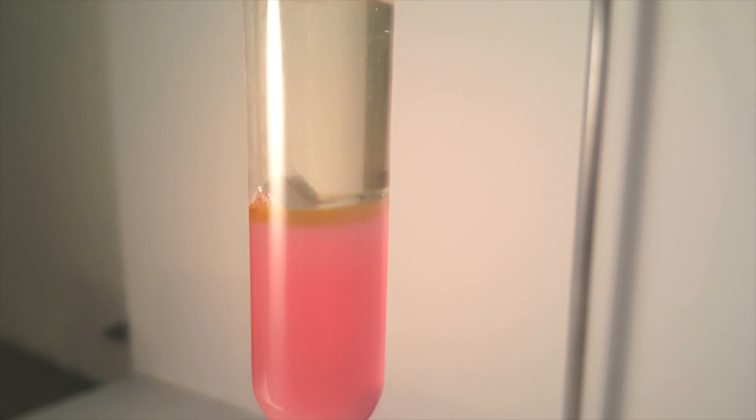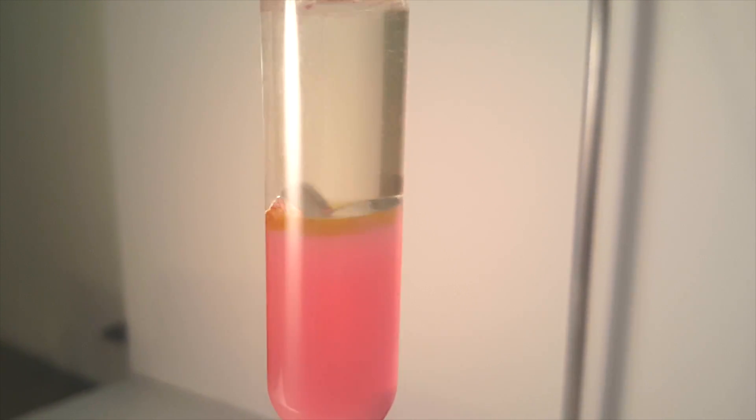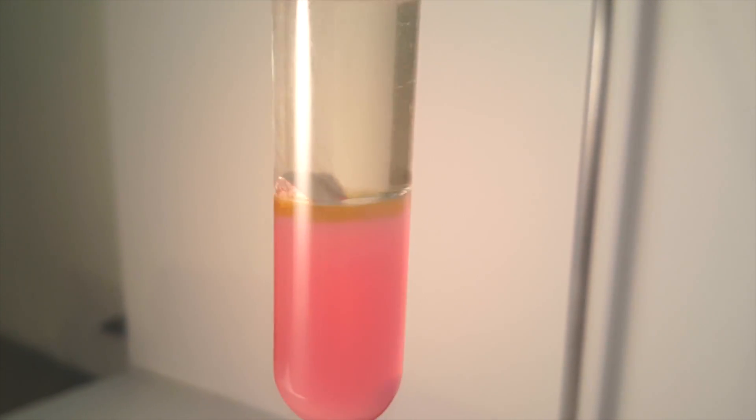Even though I got the results I wanted, I decided to repeat the experiment once more. I didn't get any interesting results though, but I did get another close-up of the beauty of sodium without the oxide layer, so I included that here.